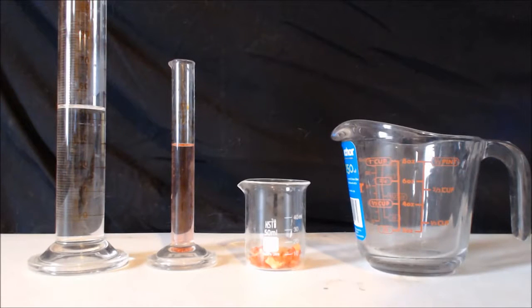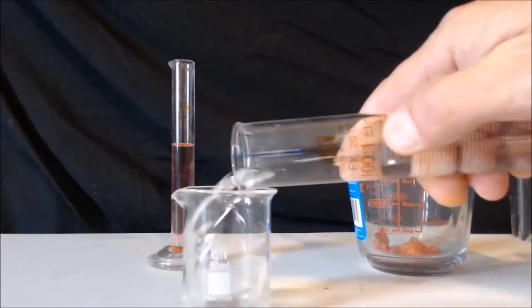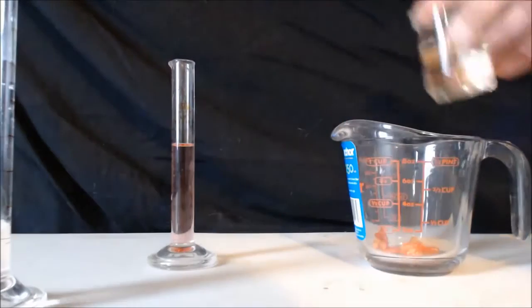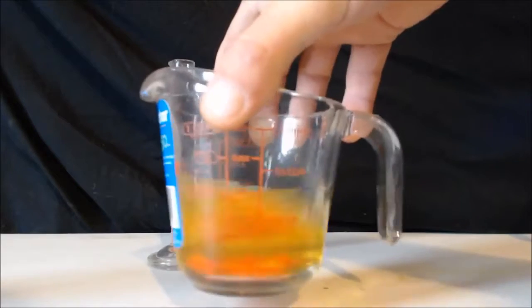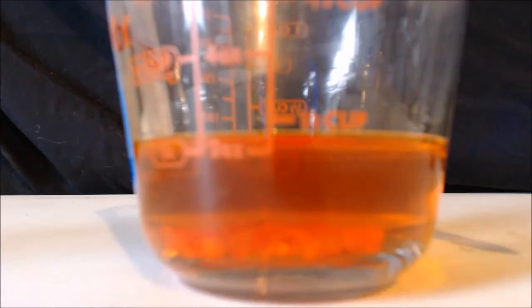All right, now from left to right, I have 53 milliliters of water, 8.5 milliliters of sulfuric acid, and 10 grams of potassium dichromate. I'm going to mix them all together and make some chromic acid, and that will be my oxidizer. You can see it's turning more orange, and eventually it'll turn red. So we're just going to let that dissolve, and we'll get back to you.